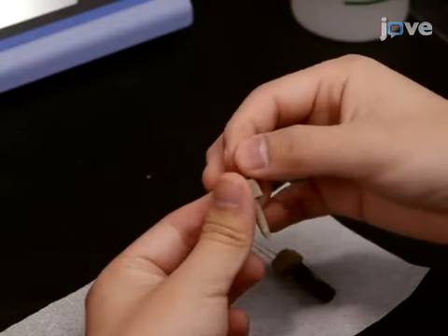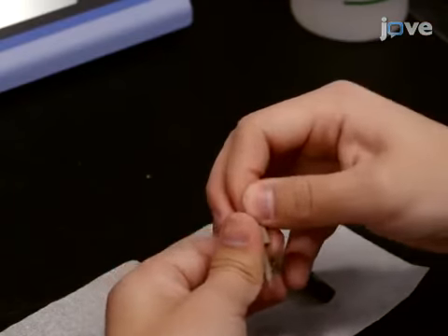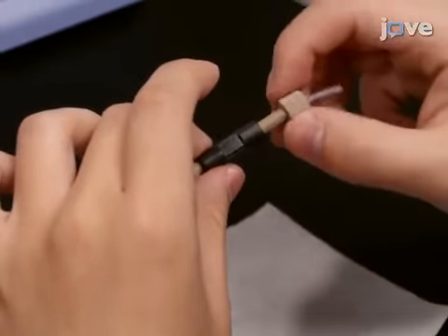Then, insert and tighten a 5 centimeter long piece of 1/16 inch PTFE tubing into the opposite end of the union.